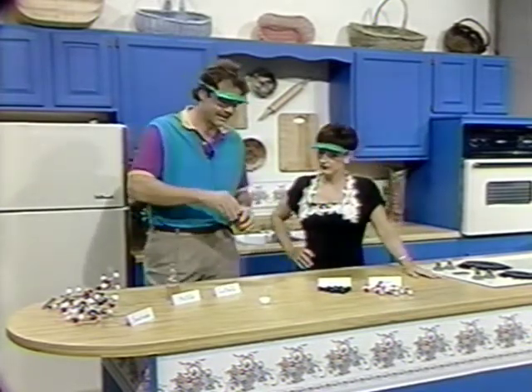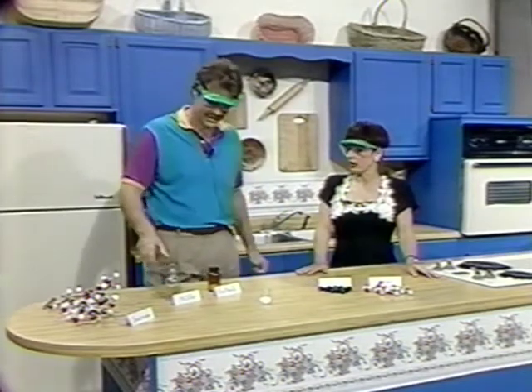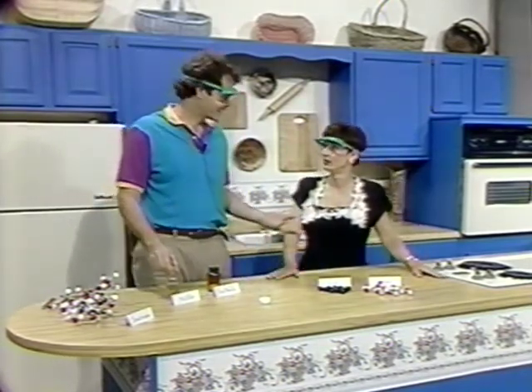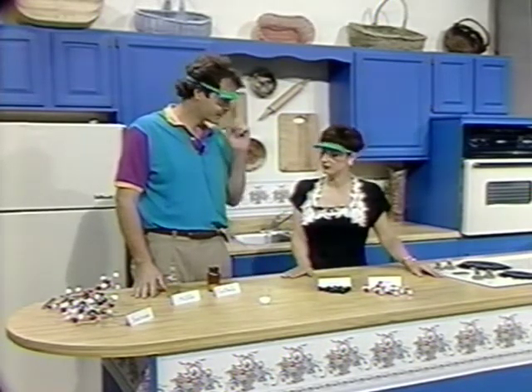We wear the safety goggles in case this reaction creates heat, and in case it produces heat faster than it usually does and splatters some of that acid out, then our eyes are going to be protected. But our skin, well, we can wash it off our skin quickly. It's not a problem with our skin, but it would be a problem with our eyes.